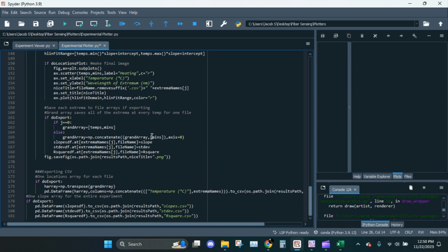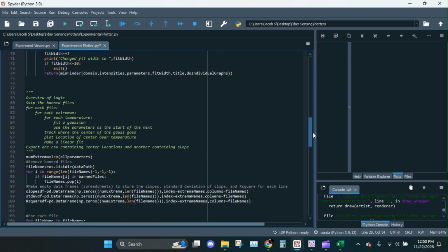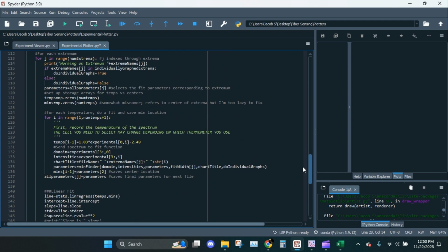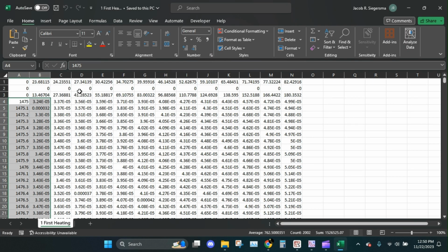I'm not going to do a tutorial on how all of this works, because that would take ages, and I think I've done a decent job of commenting it out. One important thing I will mention is down here, right? So I have this green big ol' string here. And it's about grabbing the temperature, right? So obviously we're plotting this as a function of temperature, so we need to grab the temperature from the sheet. And if we open up the sheet, here we can see it's saved in the very first row in this case.